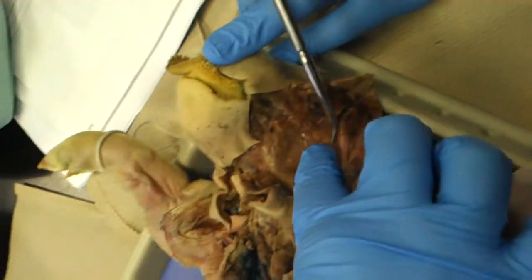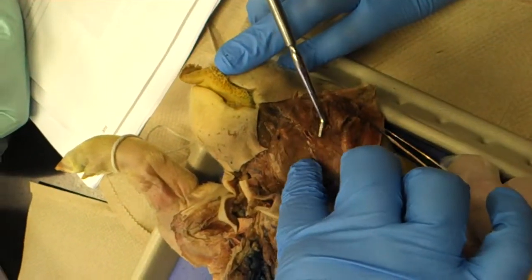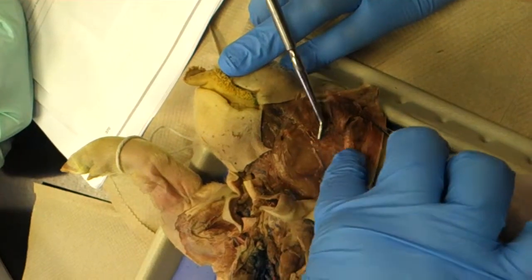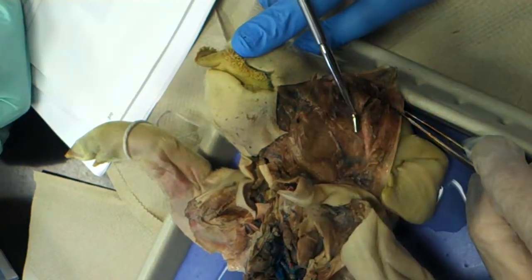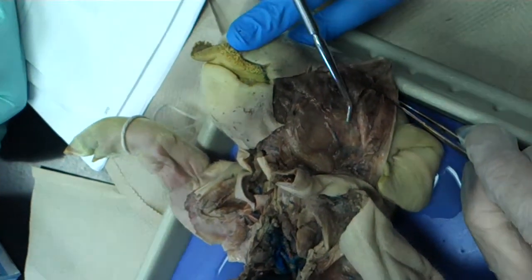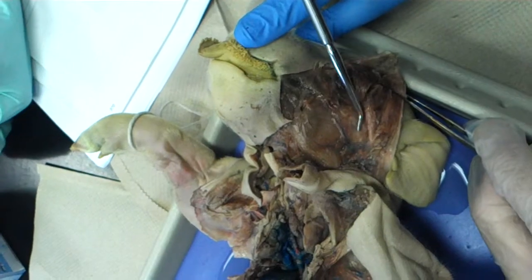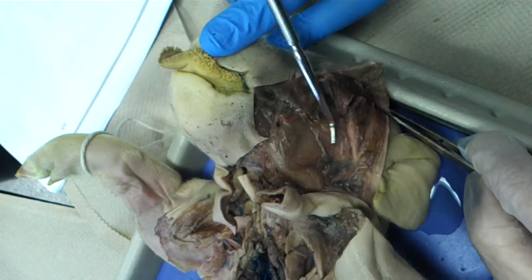See the difference though in the way these look — like the masseter looks smooth and then all these look kind of bubbly? That all should be a part of the glands, because it's like one big thing but there's three different parts to it.